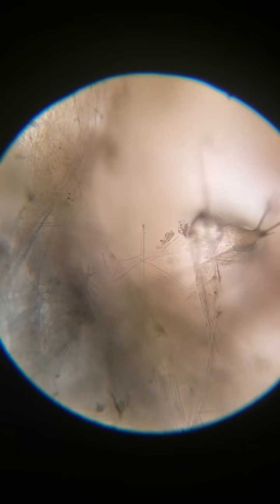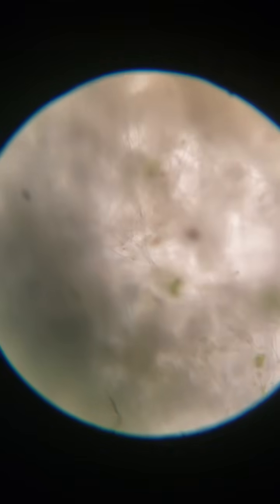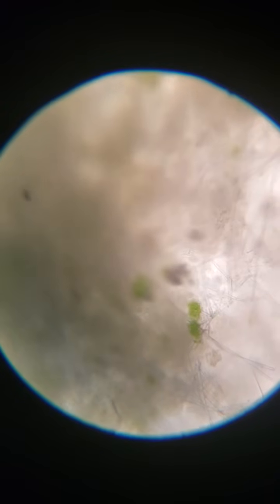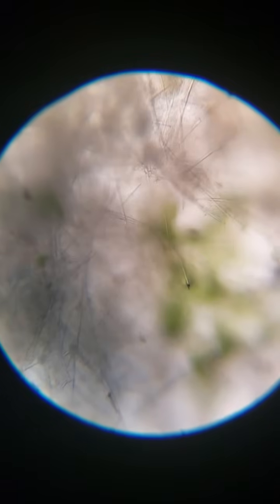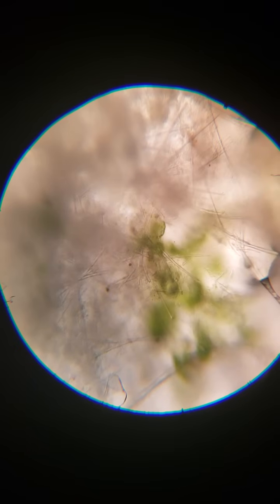Now, a lot of people try to keep these sponges, and they do pop up quite a bit in the hobby, different types. This one's from all over North America and parts of Europe, but it's odd that it's in such a warm aquarium. So this is Ephydatia muelleri, discovered in 1856 by a fella named Lieberkühn, Swedish dude. So that's what I've got to show you under the microscope here.